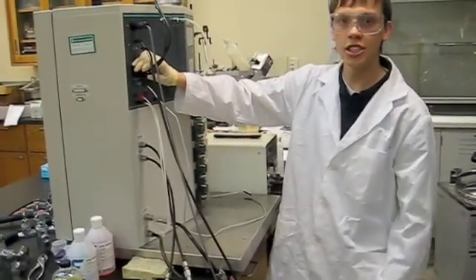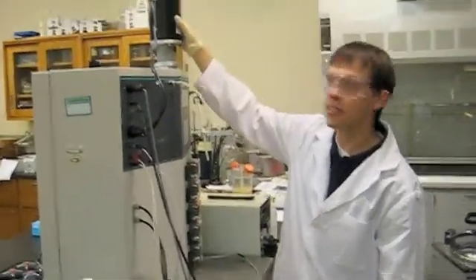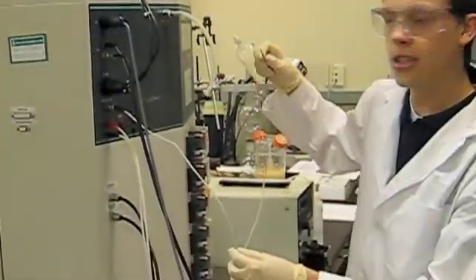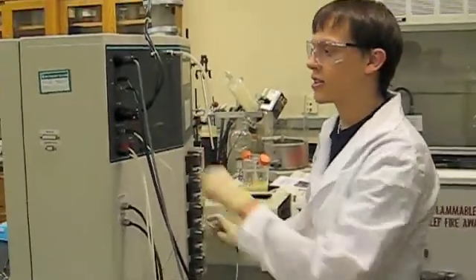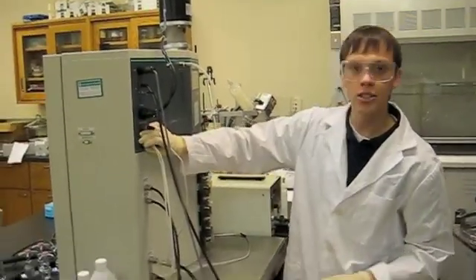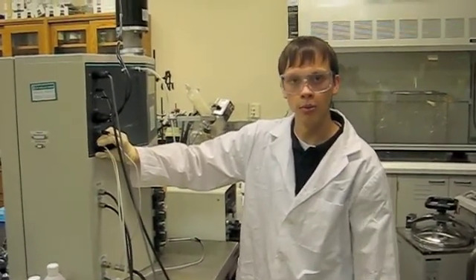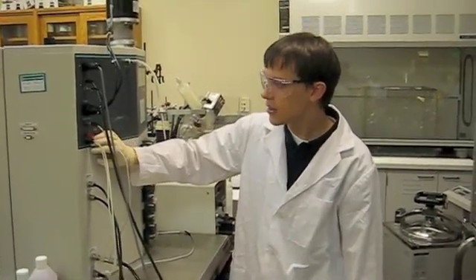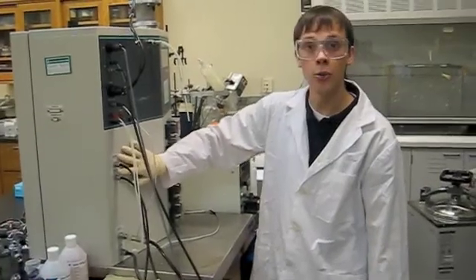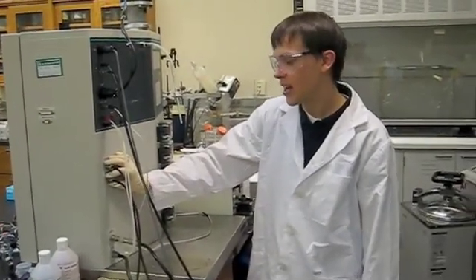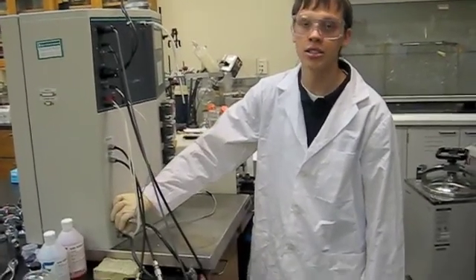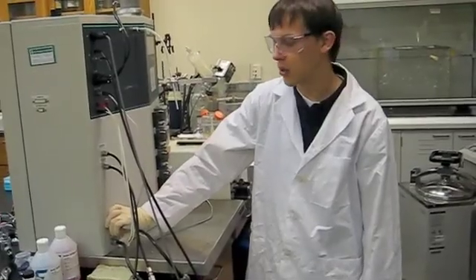Then our next connection is for the motor, which you can see right here. Then we have our thermometer, the connector for that. These next two connectors we don't use in our experiment, but they are for a level probe if you have it. Next, we have water in and water out for the condenser, and then these last two connectors are water in and water out for the water jacket.